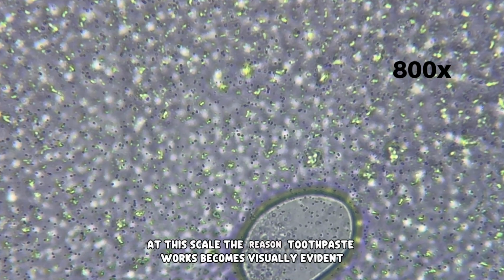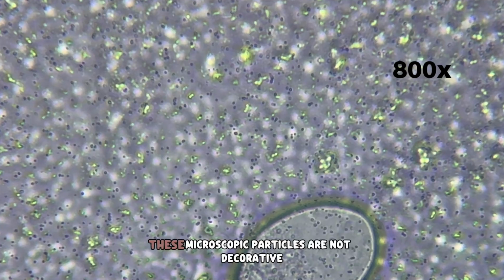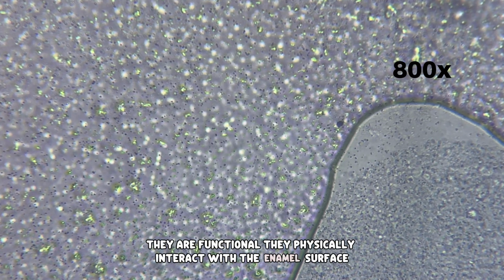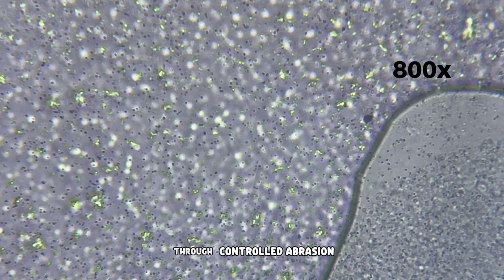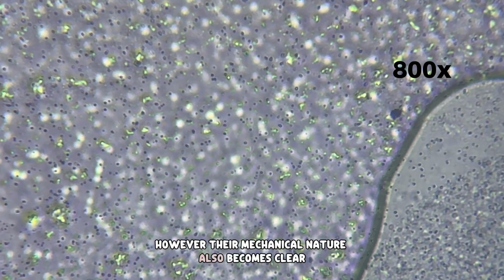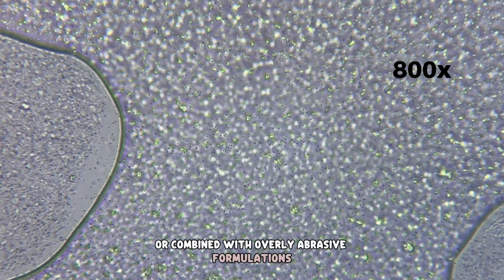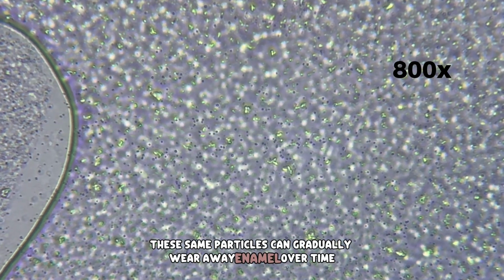At this scale, the reason toothpaste works becomes visually evident. These microscopic particles are not decorative, they are functional. They physically interact with the enamel surface, helping to remove plaque and surface buildup through controlled abrasion. However, their mechanical nature also becomes clear. Used with excessive force or combined with overly abrasive formulations, these same particles can gradually wear away enamel over time.